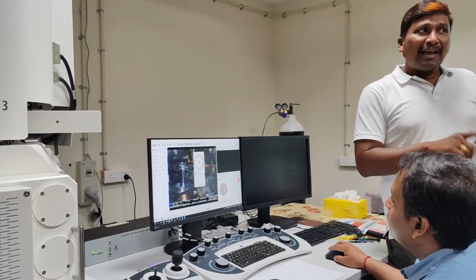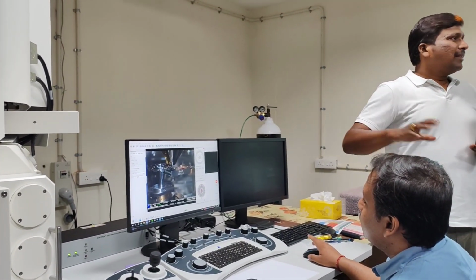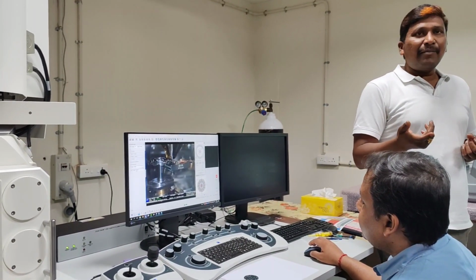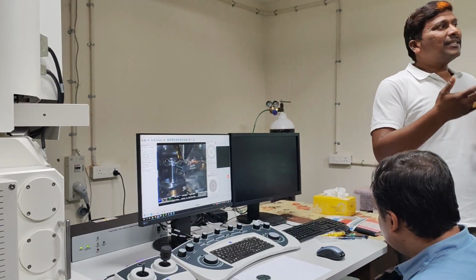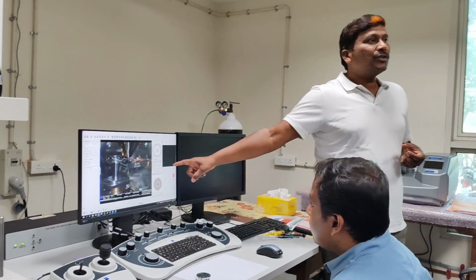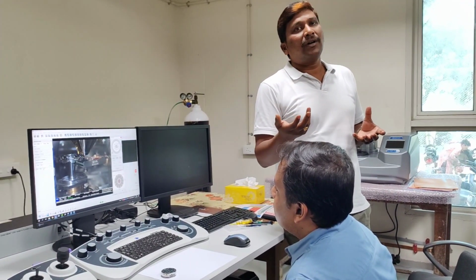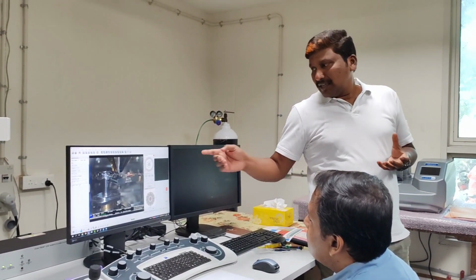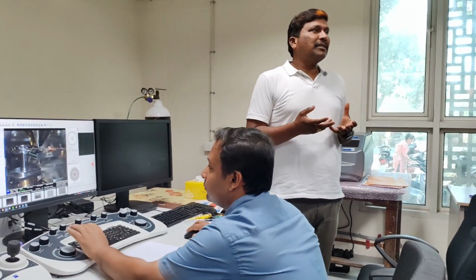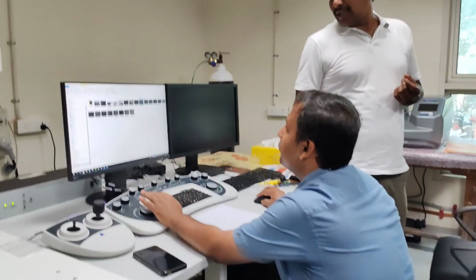Apart from that, the sample also has to be prepared in such a way, like when you submit the sample to TEM. The important thing here is that you cannot pay for TEM analysis for all samples, right? To analyze whether the sample is prepared well or not, whether it is thin, you can image those things here, and out of 10 samples, 1 or 2 samples you can proceed with for further TEM or STEM imaging. Or if you are looking for nanoparticle images which are less than 1 or 2 nanometers, even those images can be captured.